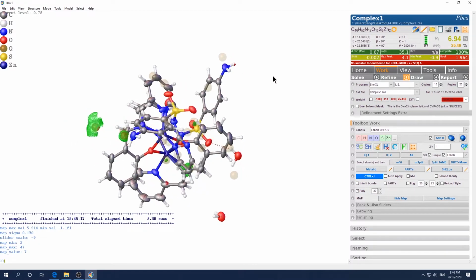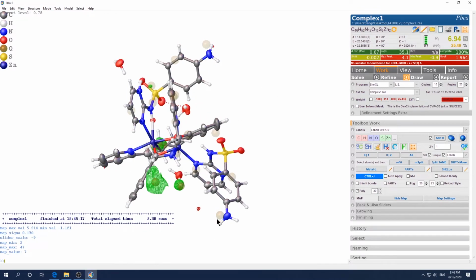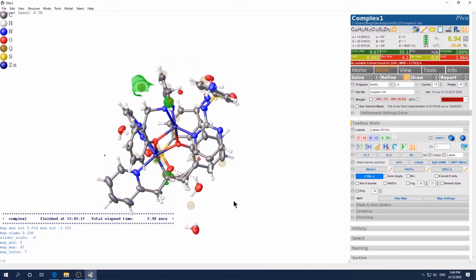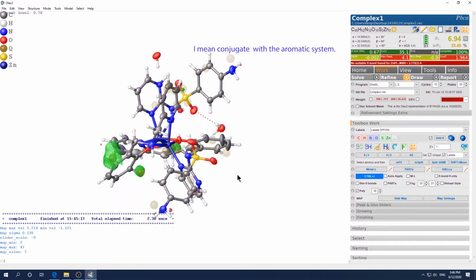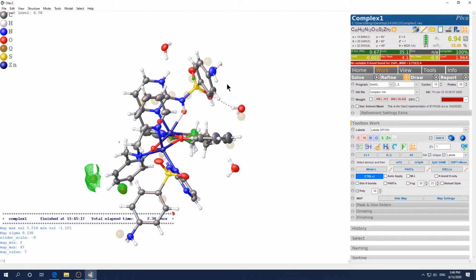So similarly, okay, that's the one I talked about just now, and similarly it has another instance here. So proton position has an electron hole here, and possibly a Q peak right in the right position. If you check the distance, it's 0.875, just a perfect hydrogen N-H bond there. And if you look carefully, this Q peak actually lies on that plane, meaning this nitrogen is in the aromatic system. Similarly, for this case, this Q peak lies on this plane.